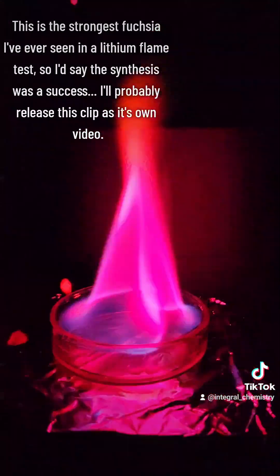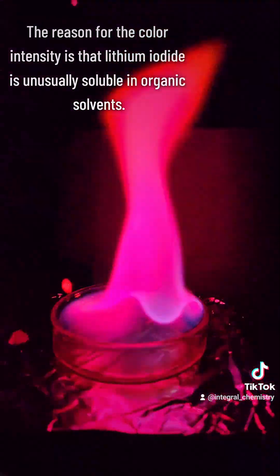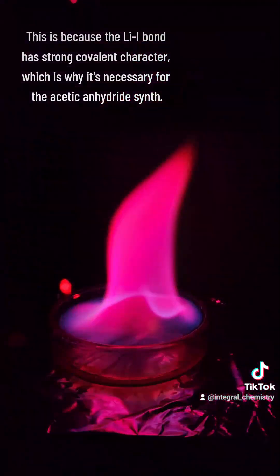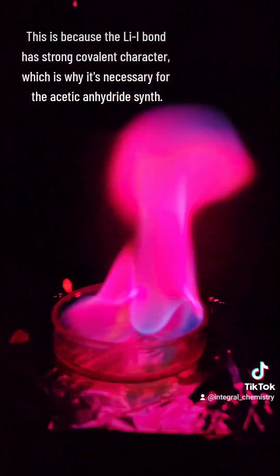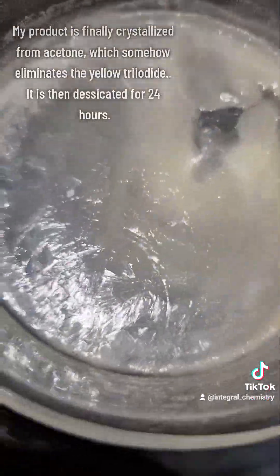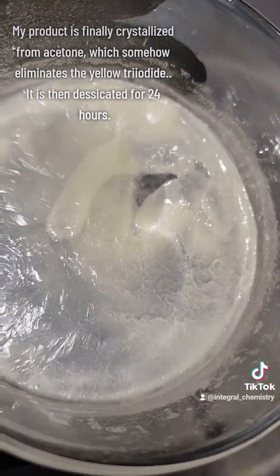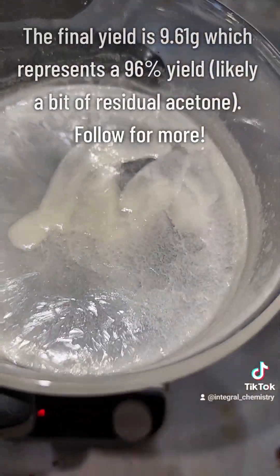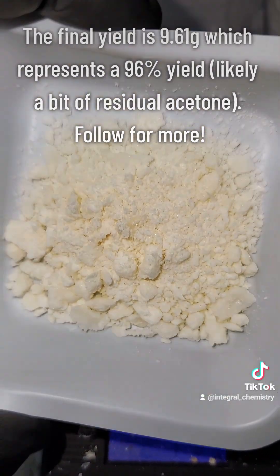The reason for the color intensity is that lithium iodide is unusually soluble in organic solvents. This is because the lithium iodide bond is very weak and has more of a covalent than ionic character, which is why it's necessary for my synthesis of acetic anhydride. Here you can see my lithium iodide crystallizing from acetone, which I then desiccate for 24 hours. My final yield here is 96%, which means there's likely a bit of residual acetone, which won't be a problem.